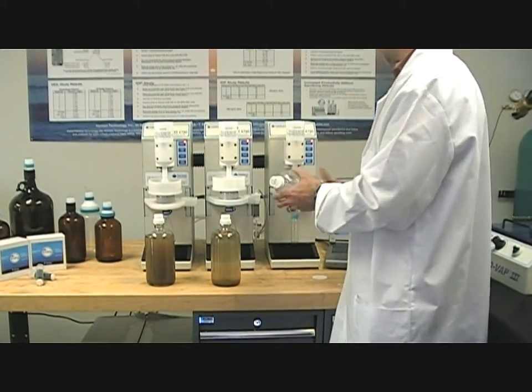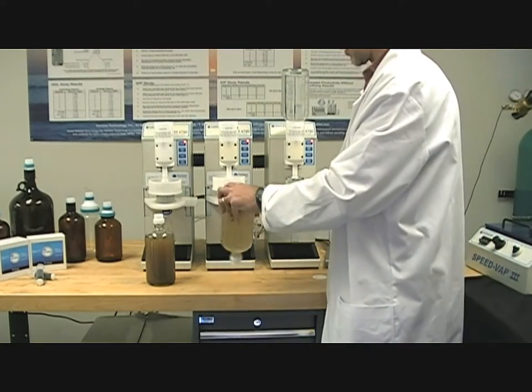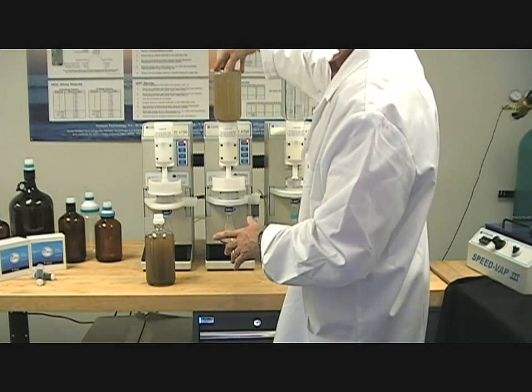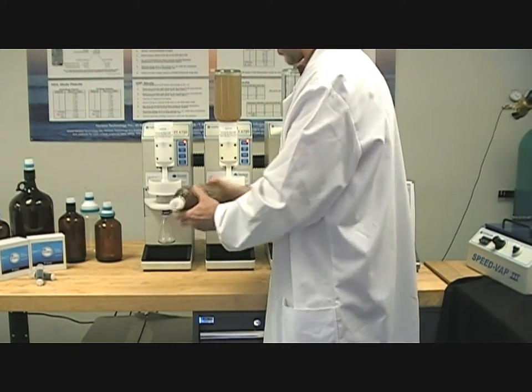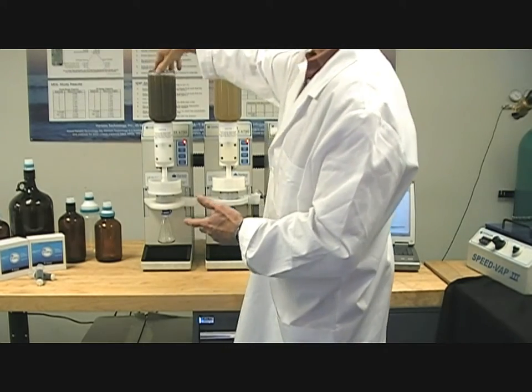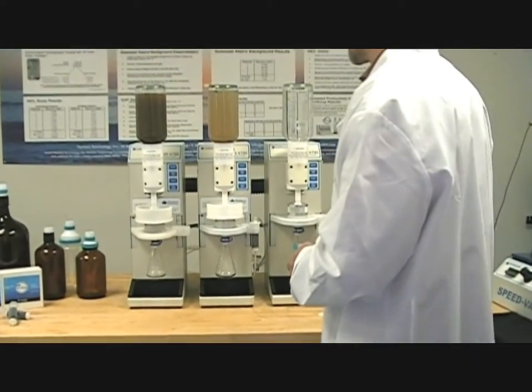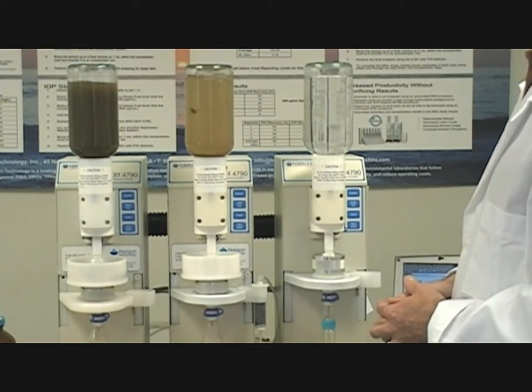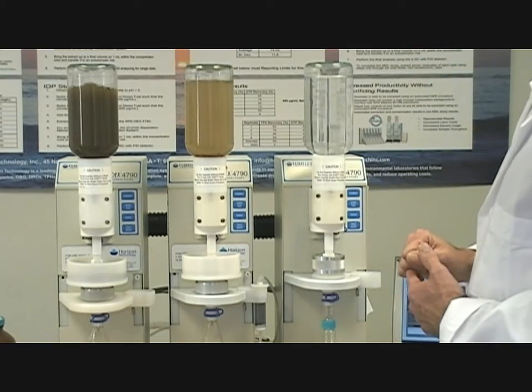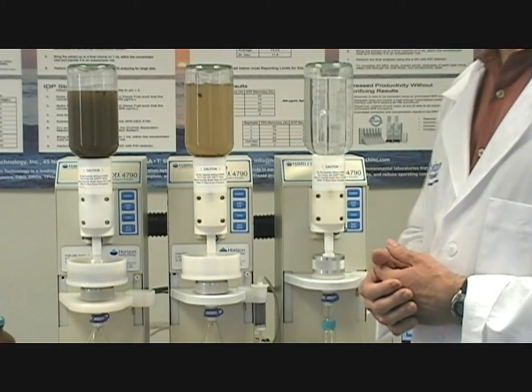I'm going to load these samples now onto the extractor. This is a plain sample. Six grams of sediment in this liter sample. And then we have — I'm going to shake this one up really well — 35 grams of sediment. Now I'm going to start the water filtration step, and you'll see the water filtering onto these various disk holders. It will take approximately 10 minutes to process a really clean sample filtering through the disk, and approximately 20 to 30 minutes for a dirty sample.